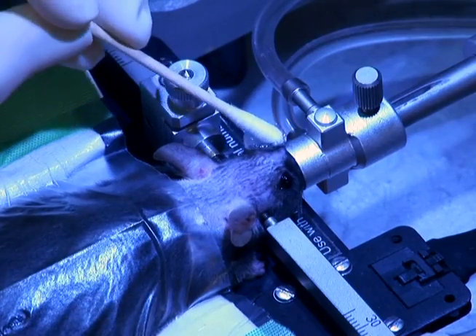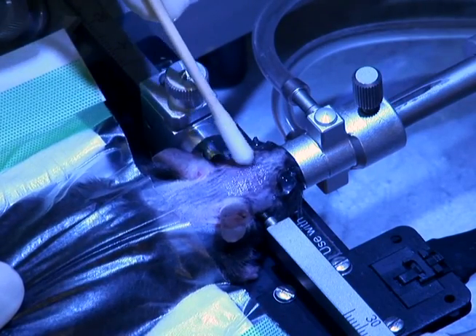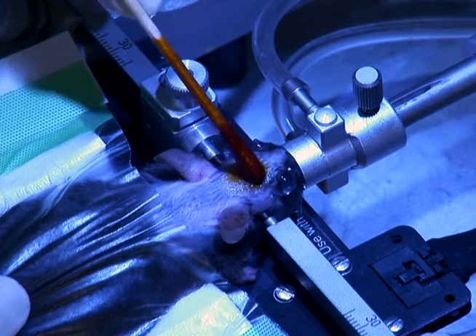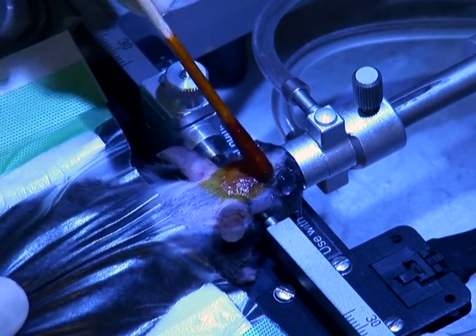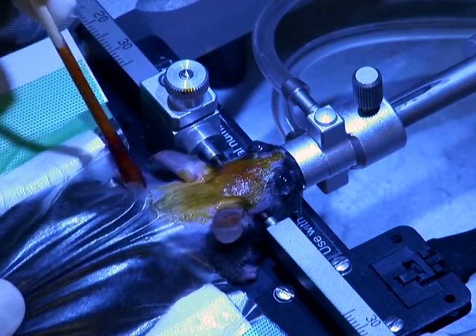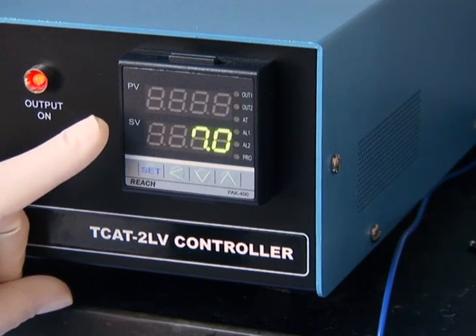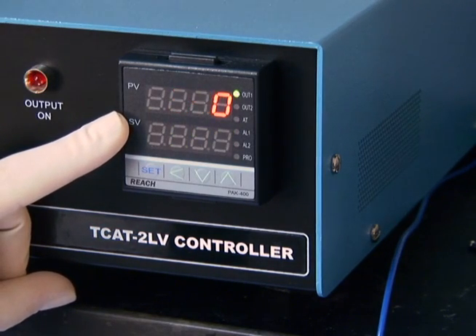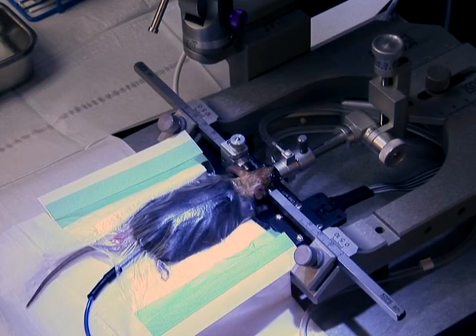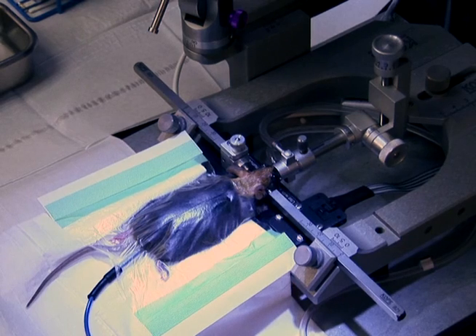Dab eye ointment onto each eye. Wipe the top of the head and neck with a cotton swab dipped in 95% ethanol, followed by a cotton swab dipped in iodine to sterilize the surgical area. Also, place a sterile drape over the mouse. Ensure that the body temperature of the mouse remains at 37 degrees Celsius. A rectal probe feedback temperature controlled heating system is used here. Then, proceed to implantation of the Alzet pump.